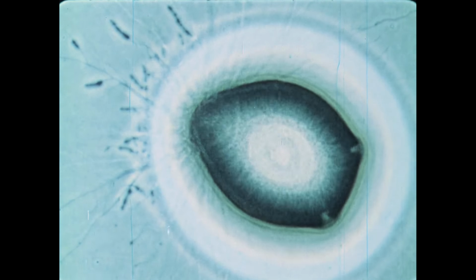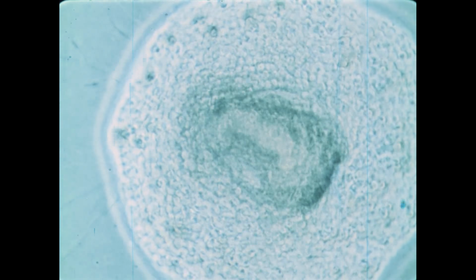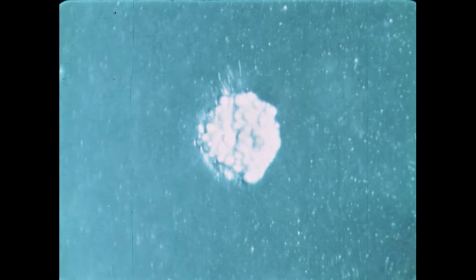Resistant sporangial plants are also formed in colonies which arise from ordinary colorless plants. When such plants release spores on an agar surface, they cannot swim away. Instead, they settle down around the parent plant, encyst, and develop into second-generation plantlets.